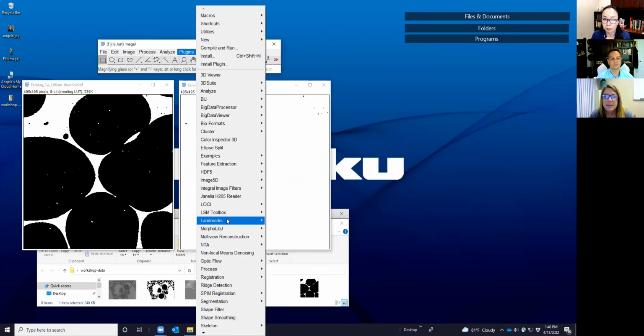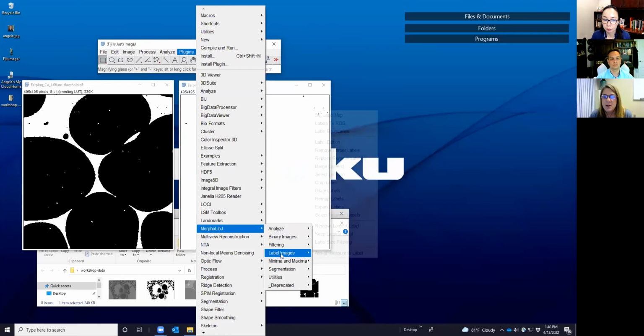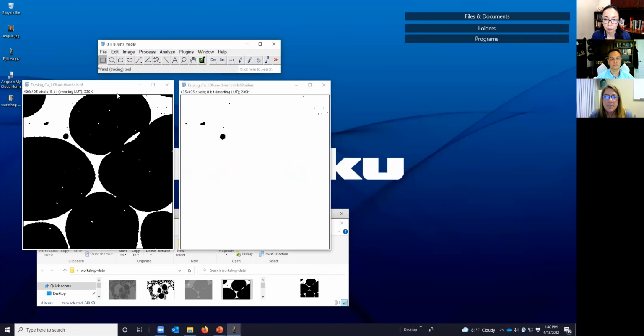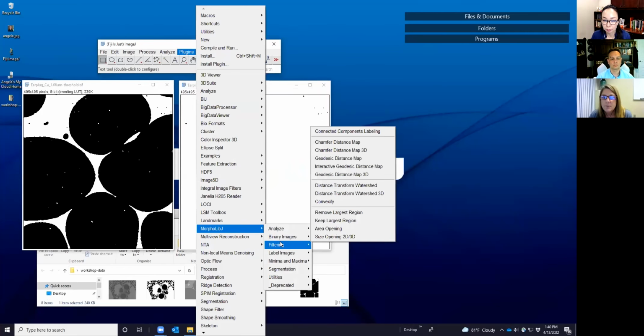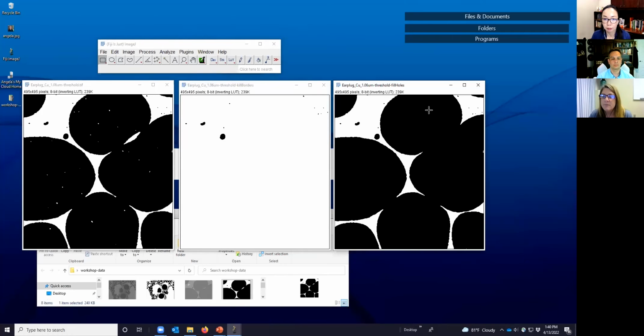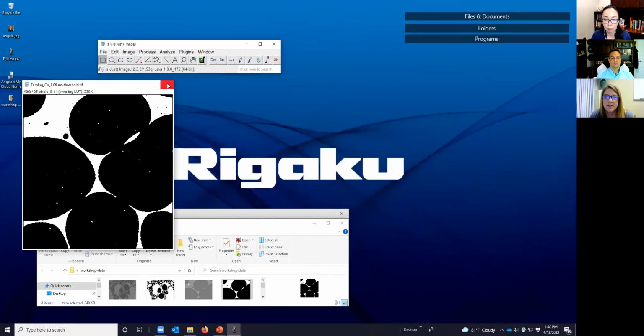And alternatively, if we use this on fill holes, plugins, got to select the window, filtering, fill holes, then we get the voids, their holes are filled, but so is this one here. Let's look at a different image on this example.